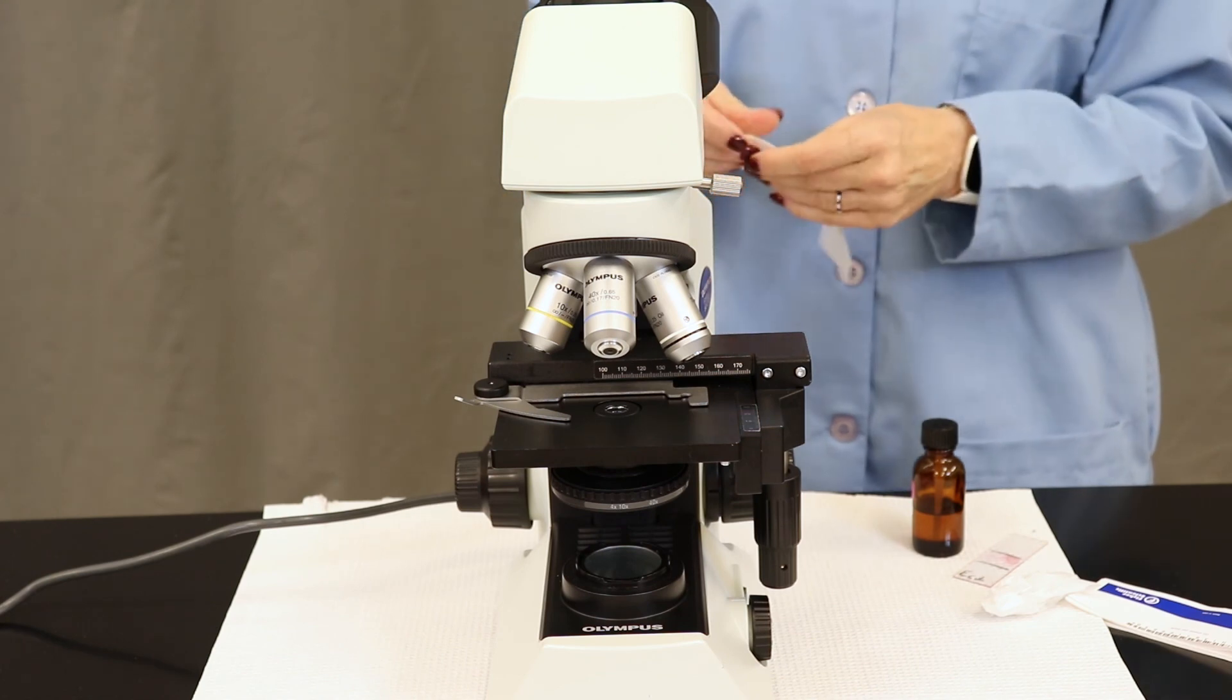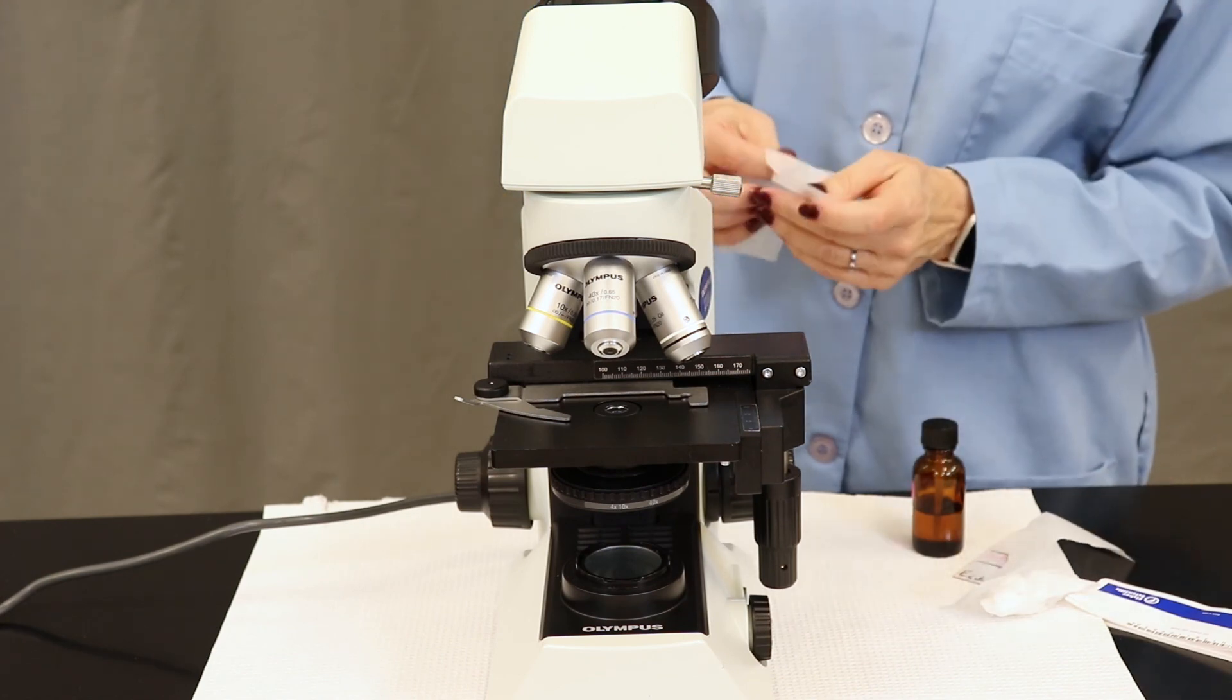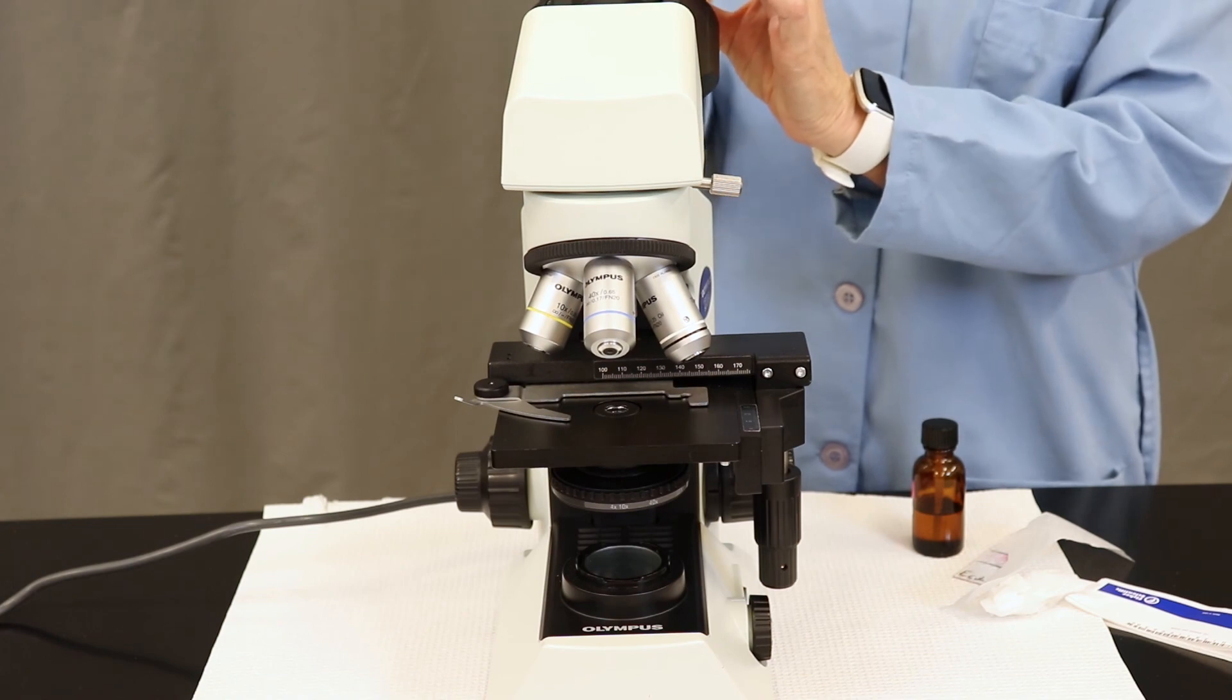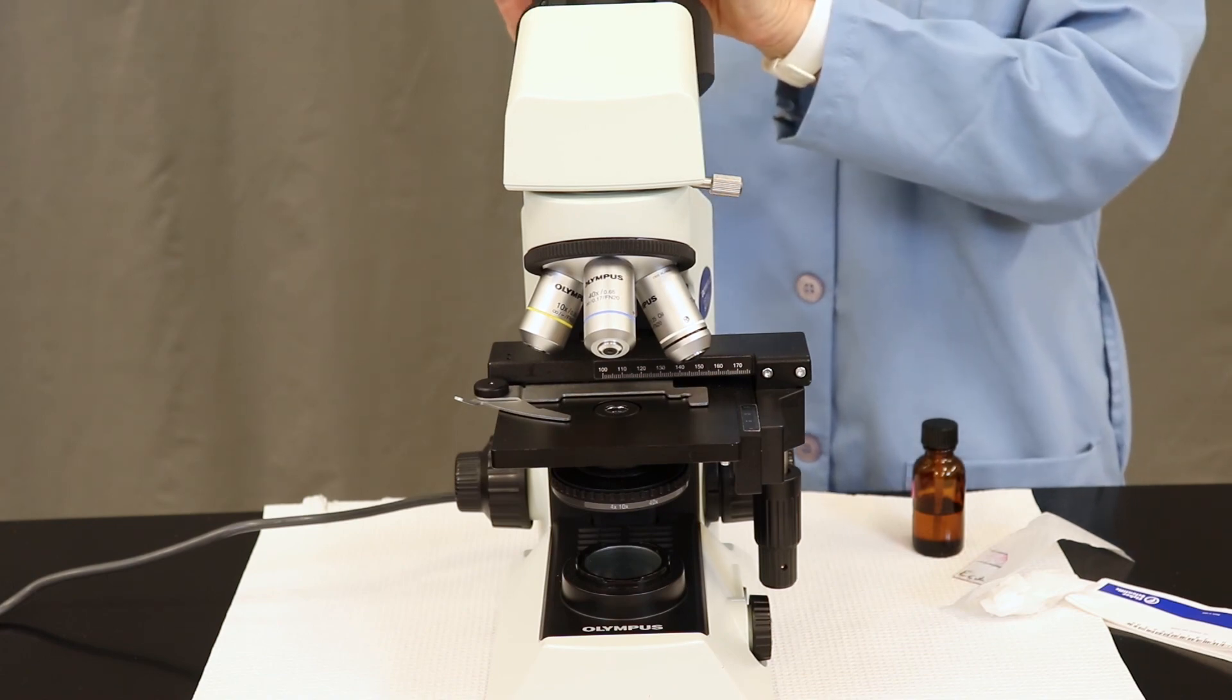Clean your ocular lens and you can wipe off the ocular lens when finished.